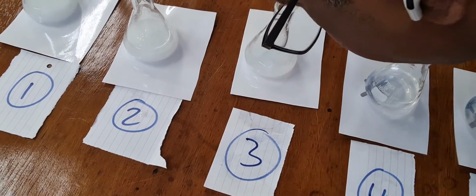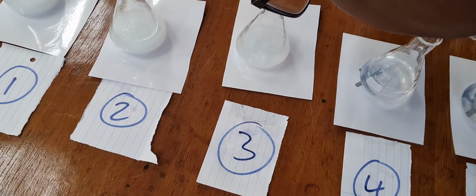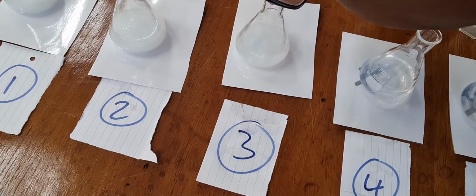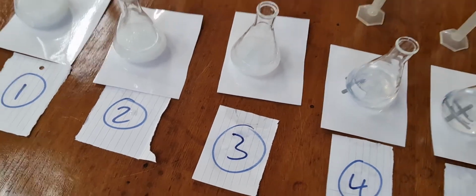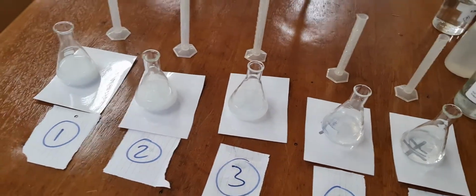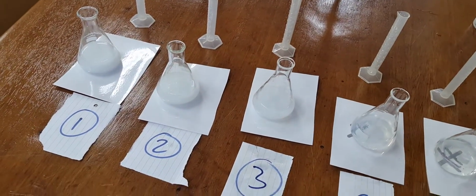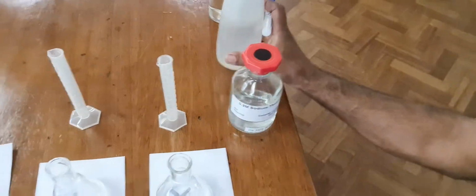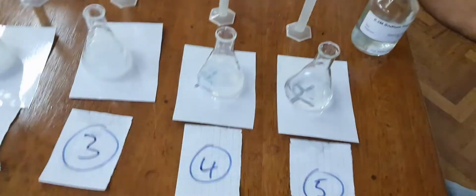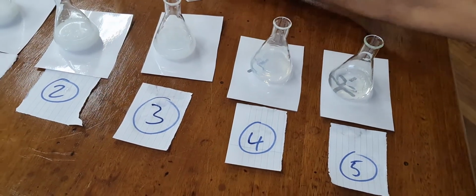If I look at the third one, I can just about see the cross, and oh my God, I cannot now see it at all. And therefore I take the time, which is 2 minutes 20 seconds. And then we can focus on the last two. Let me show you the results.